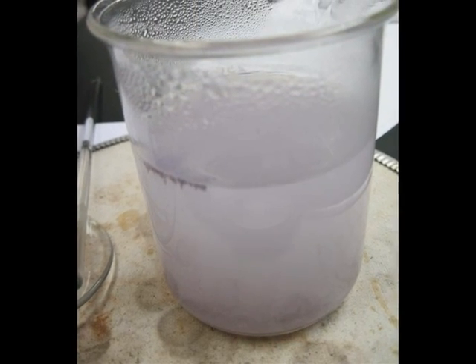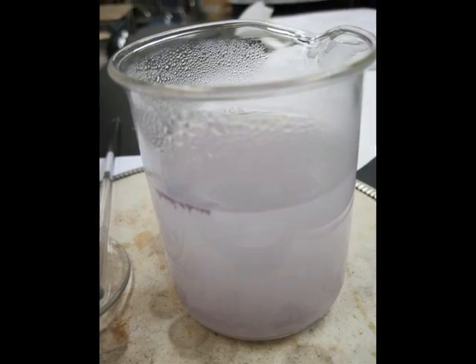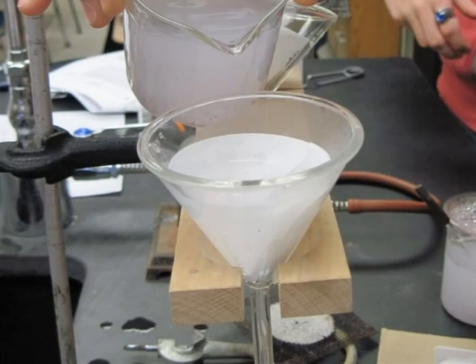After heating the beaker gently for approximately 10 minutes, allow the beaker to cool. Filter each of the samples into the pre-weighed filter paper.